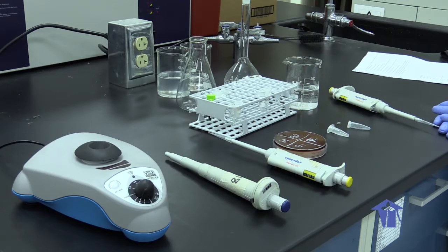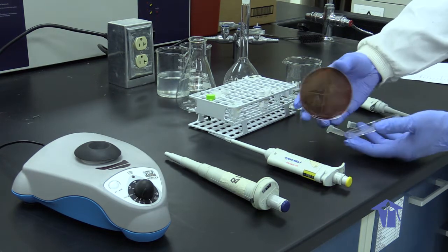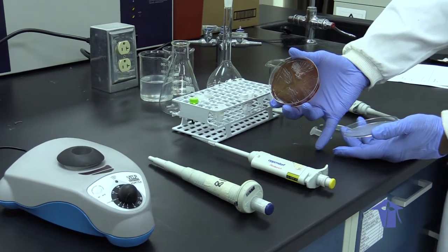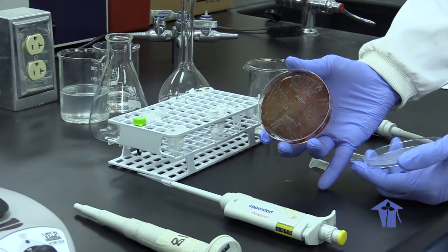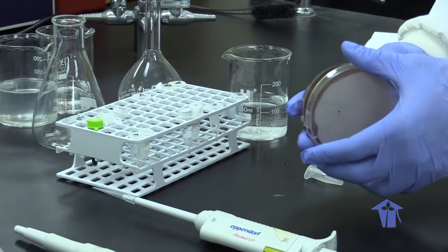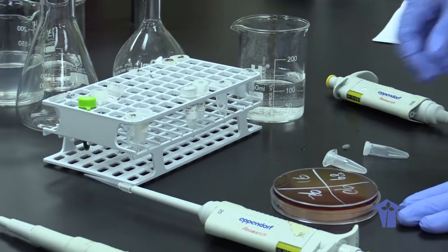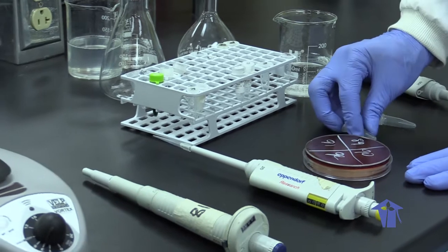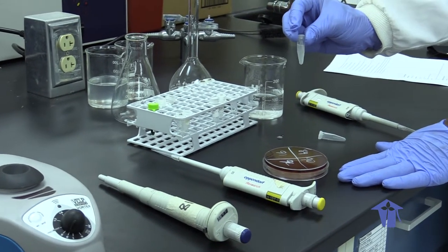In order to begin our DNA extraction, we would of course start with our cells of choice. Today, our cells of choice would include gram-negative bacterial cells. These cells have been grown overnight, and a few loopfuls have been suspended in tris acetate EDTA buffer.